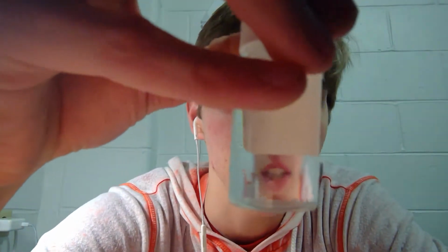Okay, for the alum experiment. My crystals have not completely formed yet, but if you look closely, you can see small specks of crystals at the bottom, which to me I perceive as seeds of nucleation. I decided to store the vial of solution just inside the door of my closet slash dresser, which should be a location that is undisturbed enough as far as the vibrations go, as well as excess light.